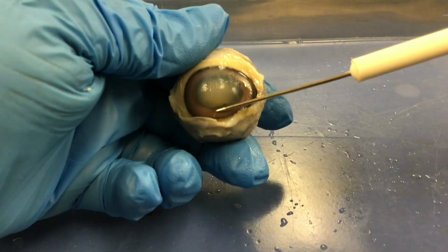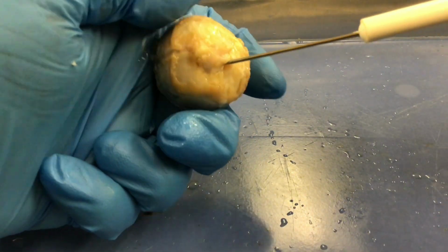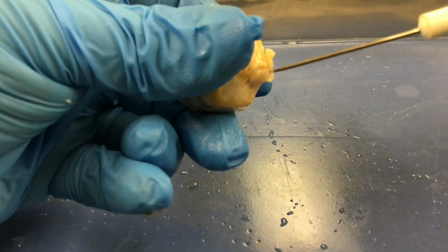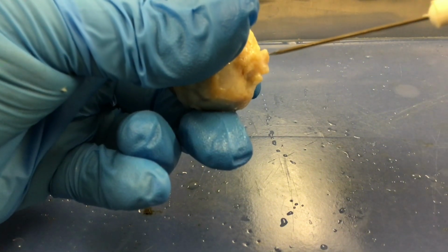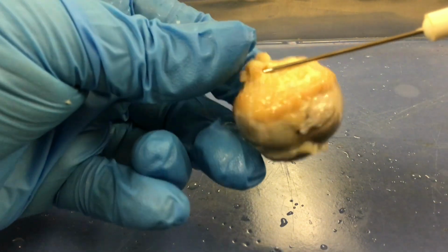So in pink eye, or conjunctivitis, there's a bacterial infection that is causing inflammation of the conjunctiva. Also on the external surface, if we go to the posterior pole of the eye, you can see this structure here. Turn it to the side a little bit. You can see this structure protruding out. This is the optic nerve, cranial nerve number 2, the optic nerve.